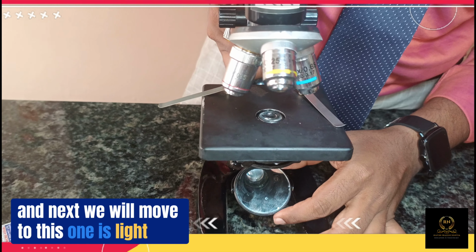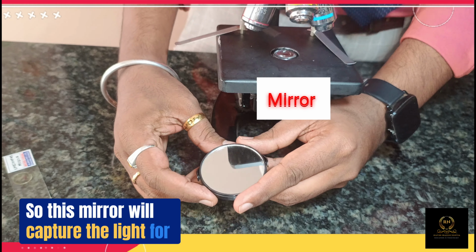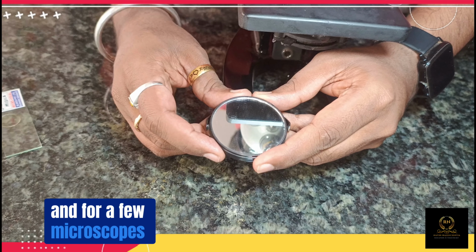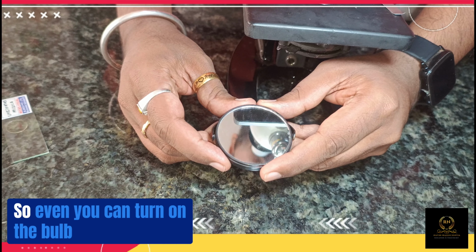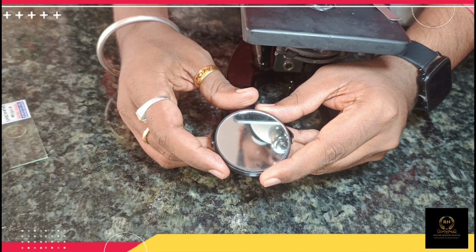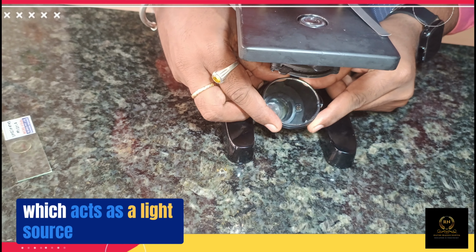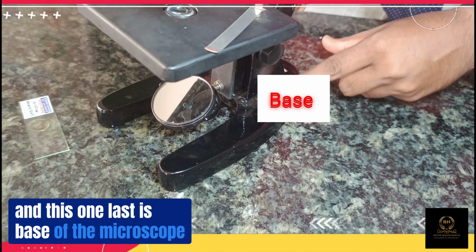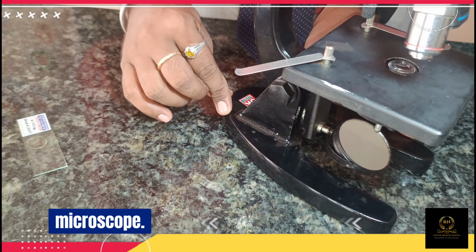And next, this one is the light source. This mirror will capture the light for your specimen, and some microscopes which run on electricity have bulbs, so you can turn on the bulb as a light source and observe the specimen. But right now, with me we have only the mirror, which acts as the light source. And the last one is the base of the microscope.